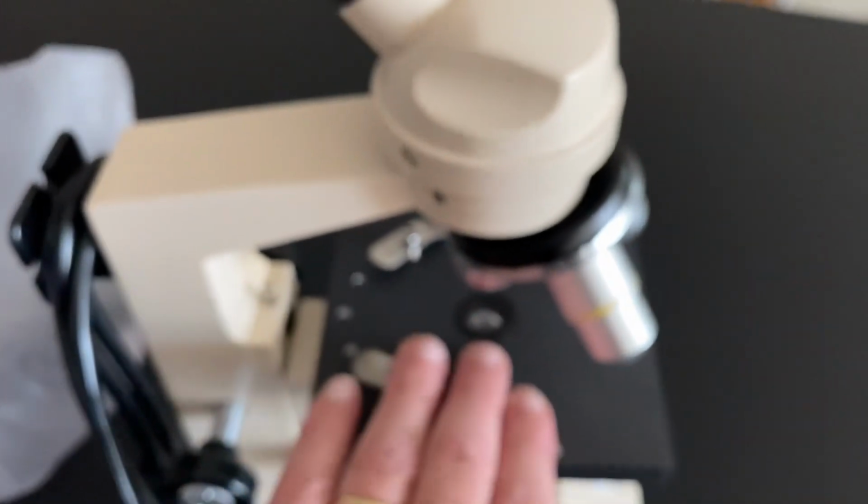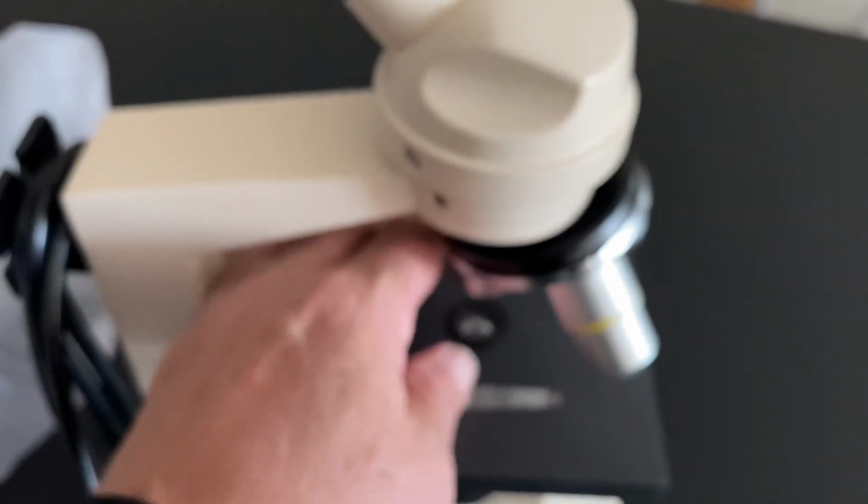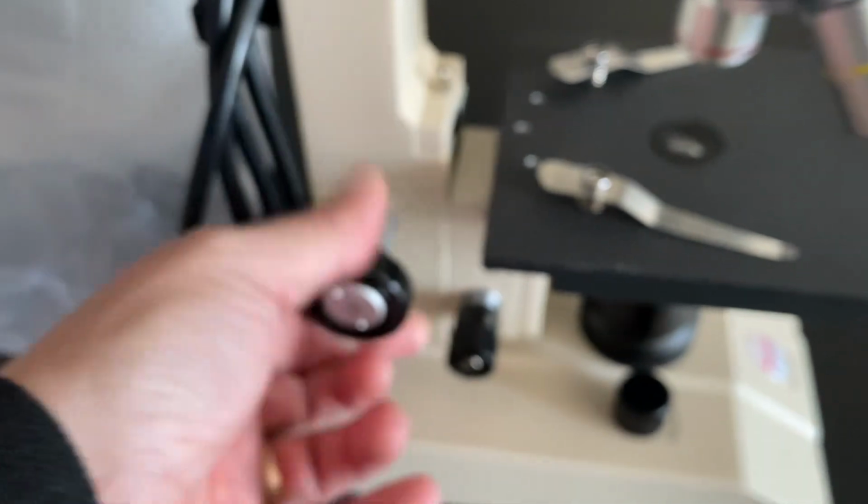Your specimen is always going to go on the slide, and the slide goes on the stage. Whenever you're looking at a specimen, there are these stage clips. I usually push them out of the way because they annoy me to no end. You always start in the lowest power lens, the shortest, stubbiest lens. Then you move your stage using what's called the coarse adjustment, which moves the stage up and down. You want your stage to be as close as you can get it to your lens. This other little knob is called the fine adjustment. It does exactly the same thing, just much more finely.